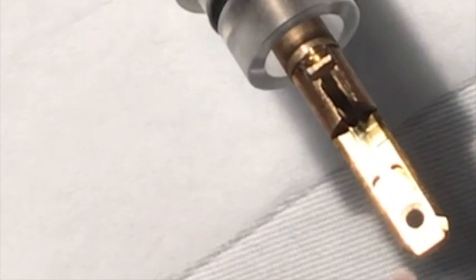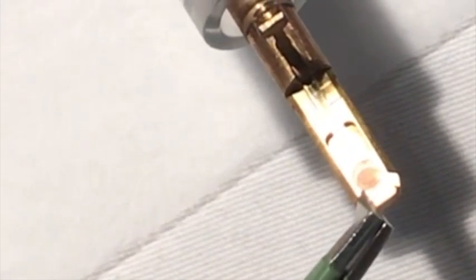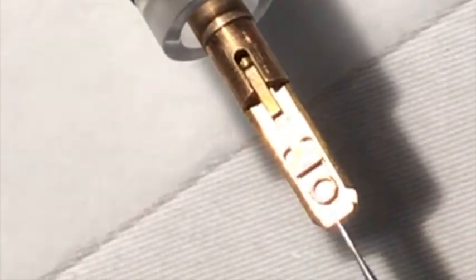When loading the specimen, we place the specimen—in this case a copper mesh—into the TEM holder. Then we use the pin to lower the ring to secure the specimen.